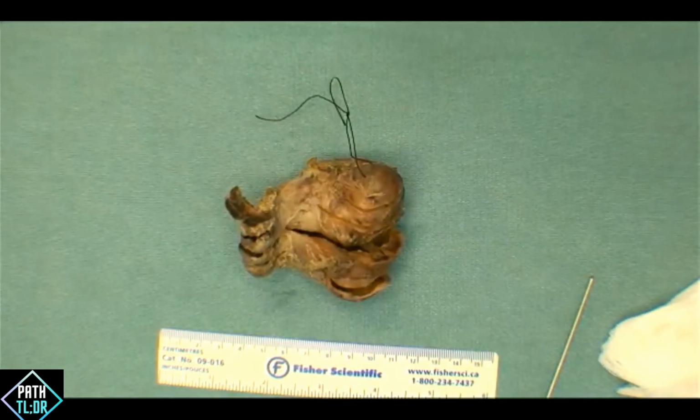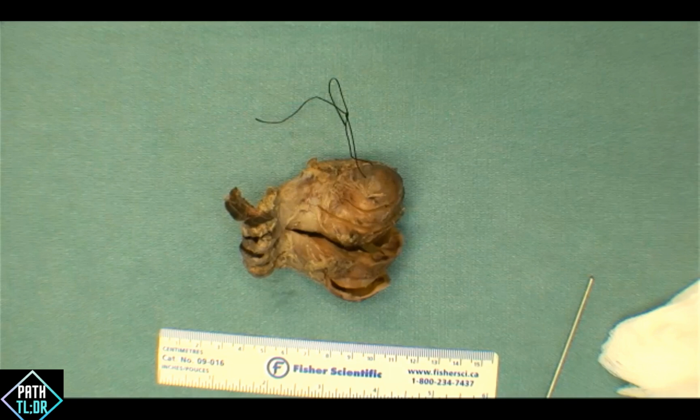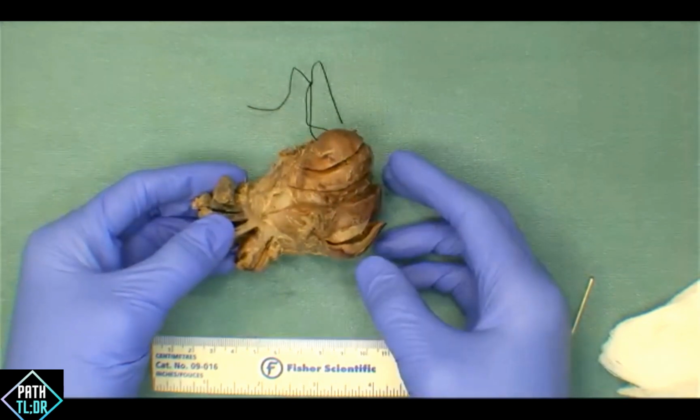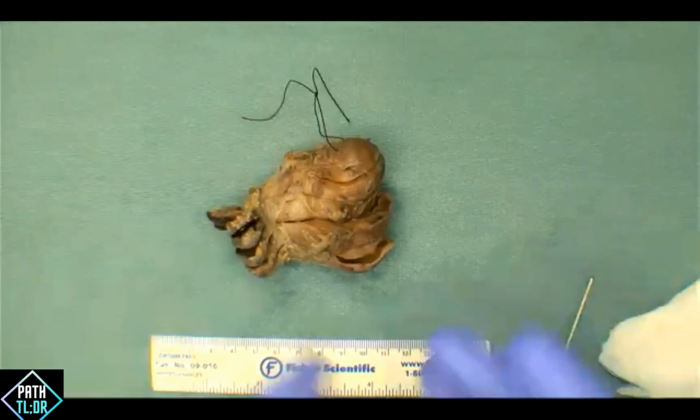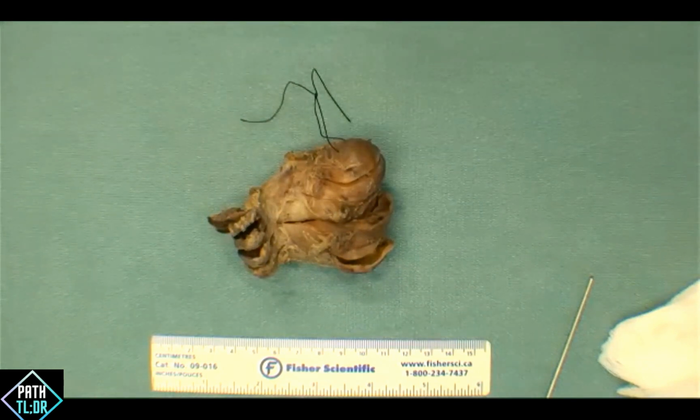I'm just curious in terms of what the community is doing when it comes to prepping. How do you prep your thyroid glands in terms of the planes of your cuts? Do you cut transverse sections, what we have here? Do you do sagittal sections going front to back? Do you bivalve and butterfly each lobe? If there's another way that you approach your sections, let us know. We ask these questions because there's no right or wrong way. The importance here is to know what your departmental protocol is.